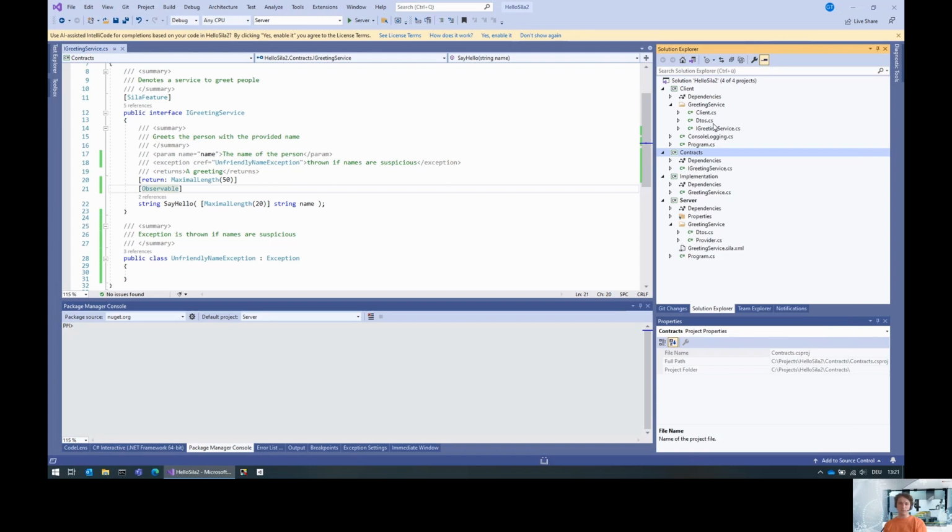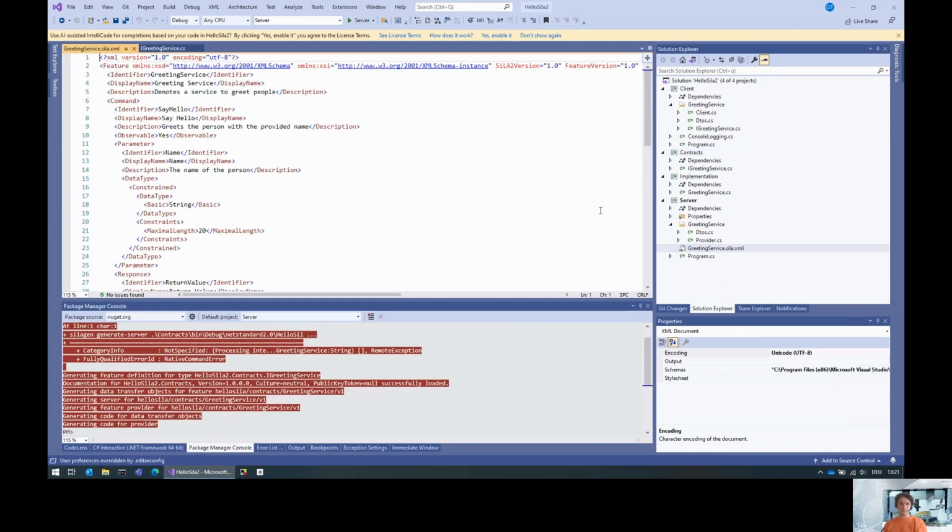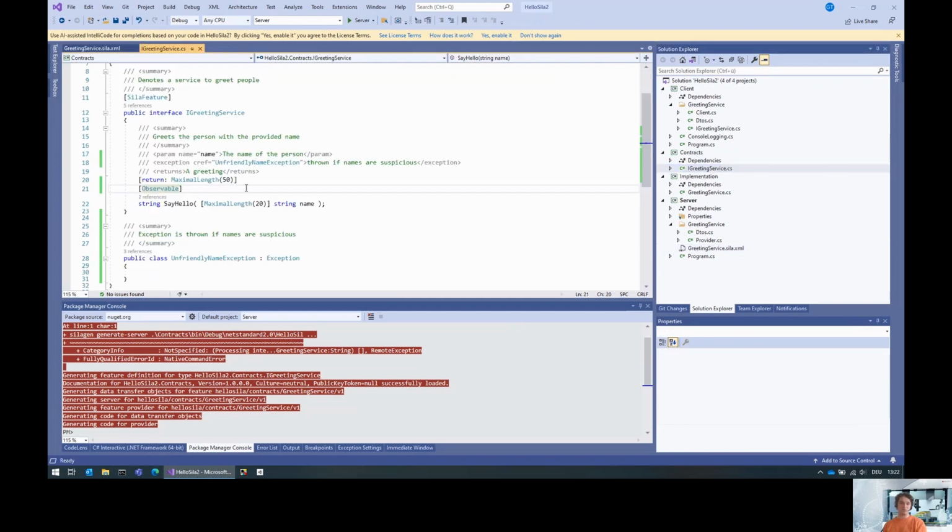And if you do that, you can recompile, regenerate, and boom, this SayHello command is observable. However, that doesn't help you in any way because you cannot respond in which state you are, and this API doesn't allow you to do that. It's only if you really want to do an observable command without any actual need for it.